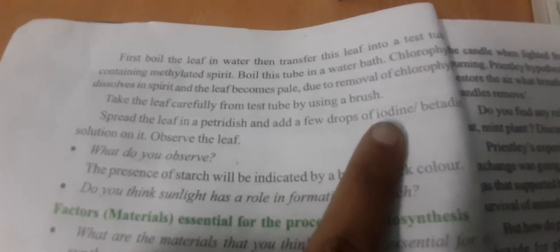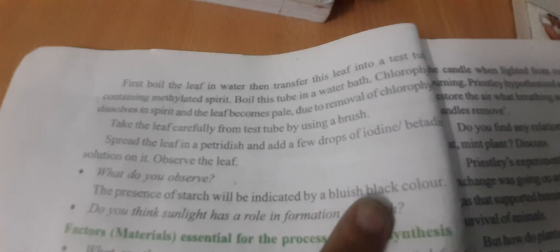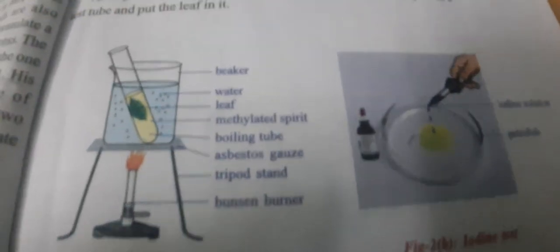After adding the iodine drops, observe the leaf. The presence of starch will be indicated by a bluish-black color. The leaf will change to bluish-black, confirming that starch is present in the leaf.